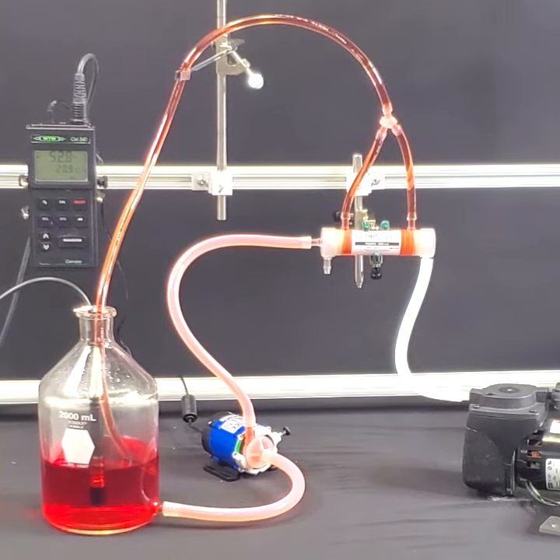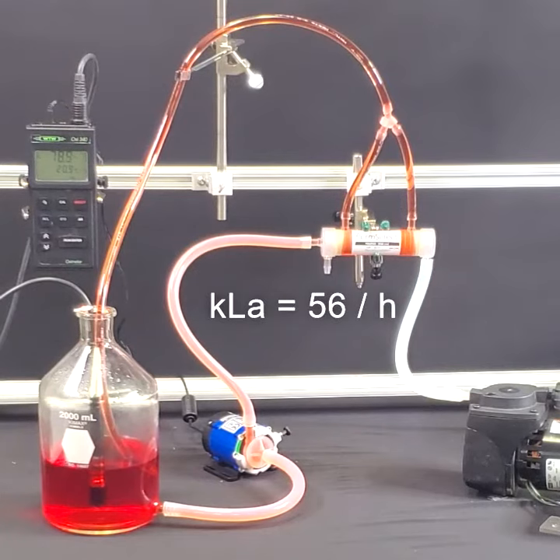We speed up the video for the next three minutes until we reach 100 percent saturation. We now calculate the kLa to be 56 per hour by tabulating the oxygen time course.